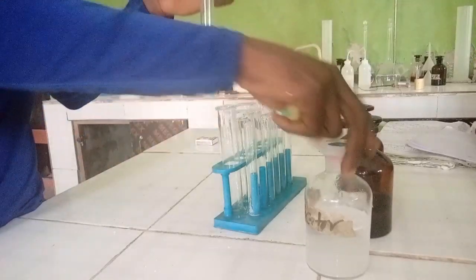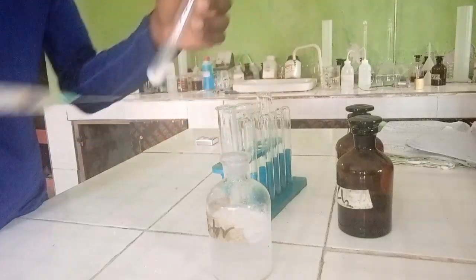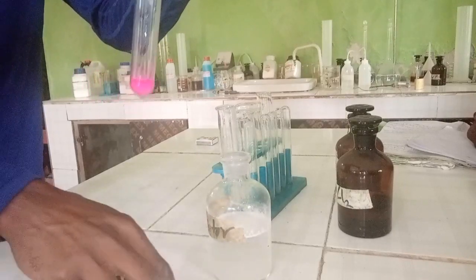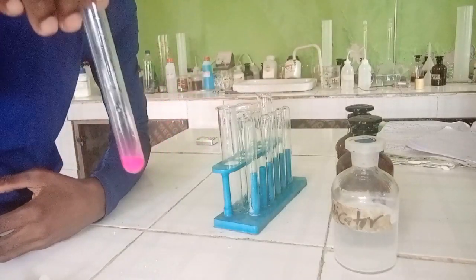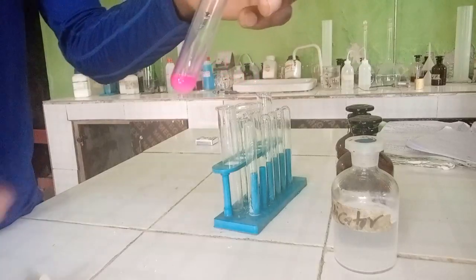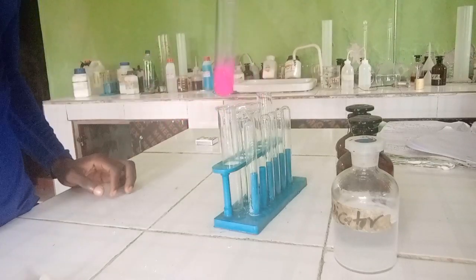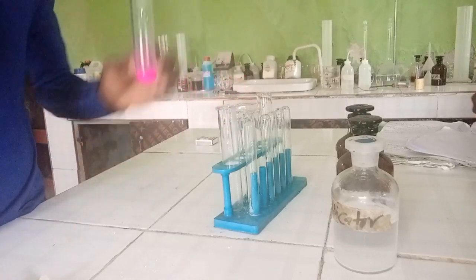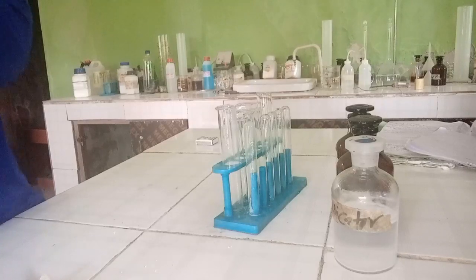Let's perform the second test. For the second portion, we are meant to add phenolphthalein indicator. Adding the indicator to the portion — the color changed pink! Out of all the anions, the only one that is basic and can change the color of phenolphthalein to pink is CO₃²⁻. So that confirms CO₃²⁻ is present. The observation is color change to pink, and the inference is that CO₃²⁻ is present.